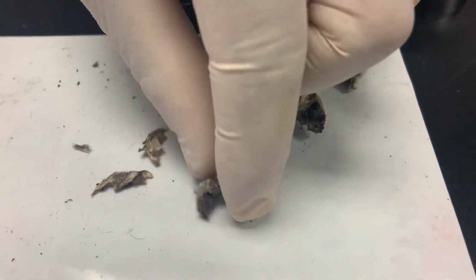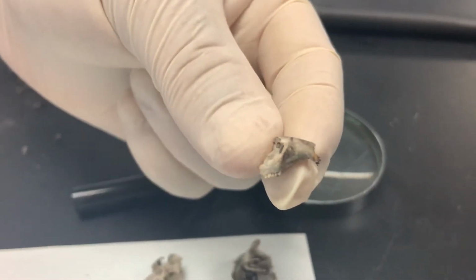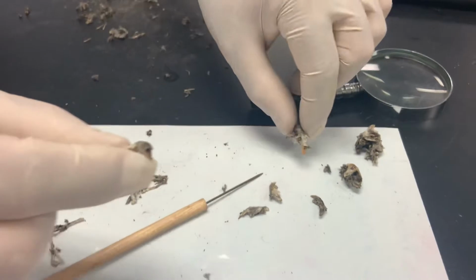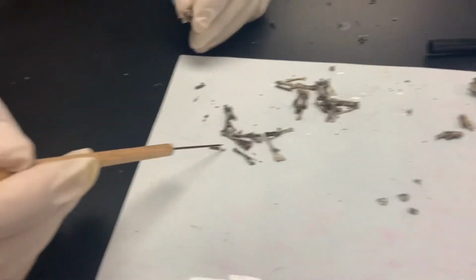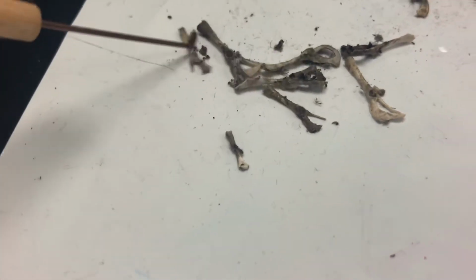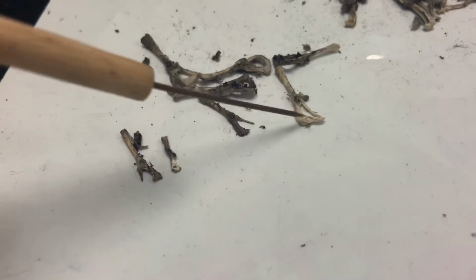All right, but the one that doesn't fit, and this is pretty interesting, is this little guy. I say little guy because it's much smaller. That can't be a mouse, because if you compare these 2, it doesn't have the same set of teeth, nor would the bottom mandible match up. And you'll notice I also found something very interesting when I was looking through here. I had different sized hips. This is actually a hip with a small hole in it. Very, very small. It's hard to see. This was another hip that got broken. But you can see they're not the same size as the mouse.